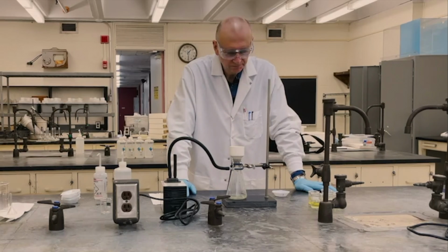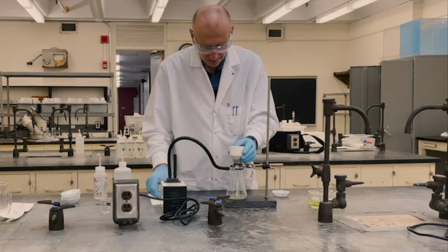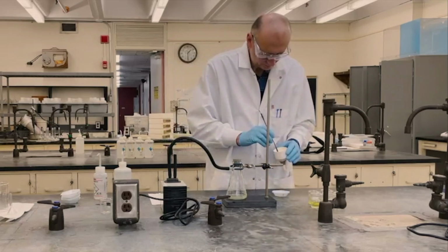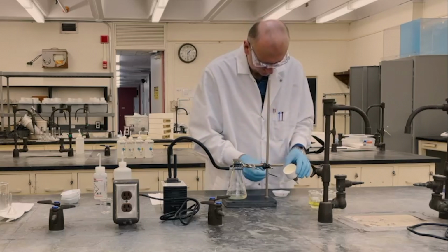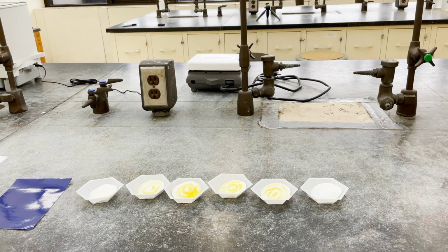After you have applied ethanol onto the filter paper, leave the vacuum on for 2 to 3 more minutes before transferring the filter paper with the product back onto weighing dish number 1. Proceed to filtrate the other beakers in a similar fashion. Make sure the number on the weighing dishes matches the number on the beakers.